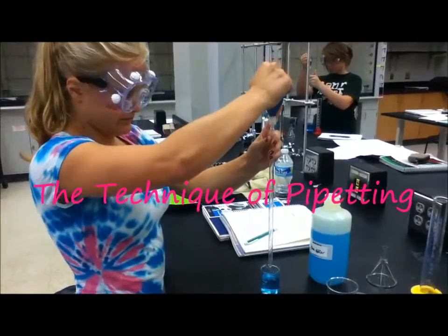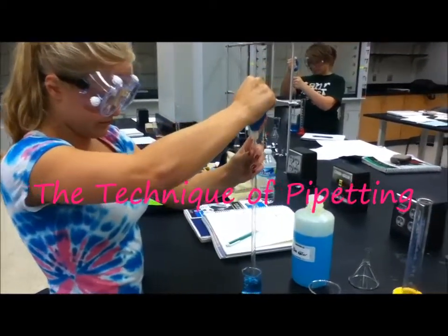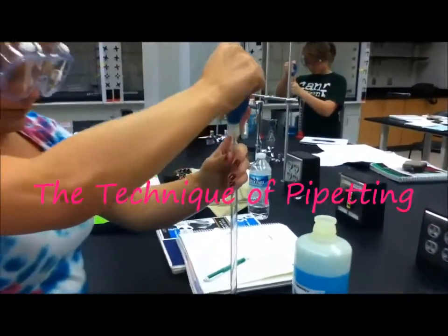This video demonstrates how to properly use a pipette. The people you see in the video are Anna Tyson, Jessica Blair, and Nightline S.